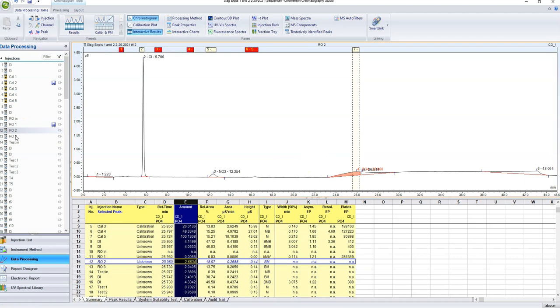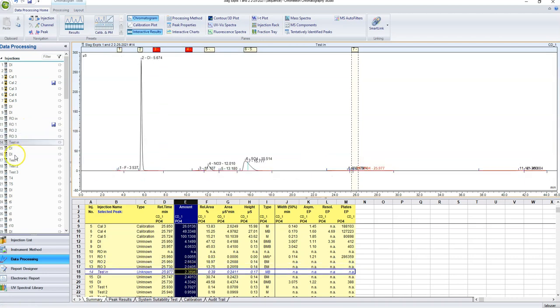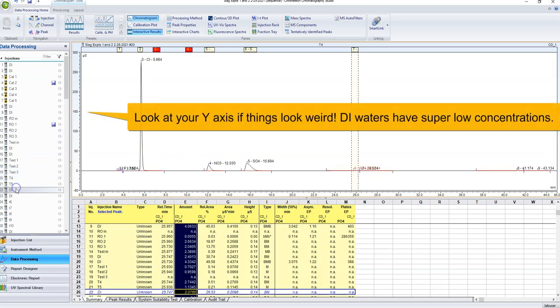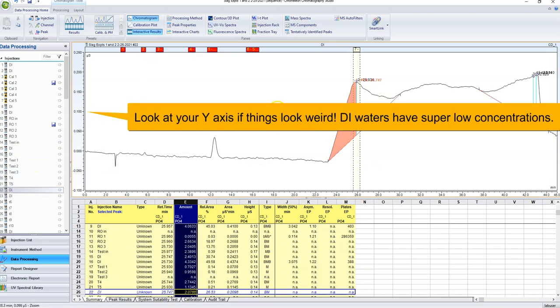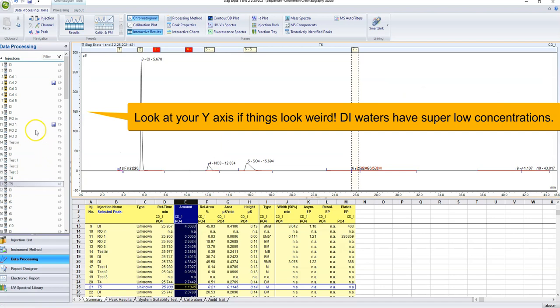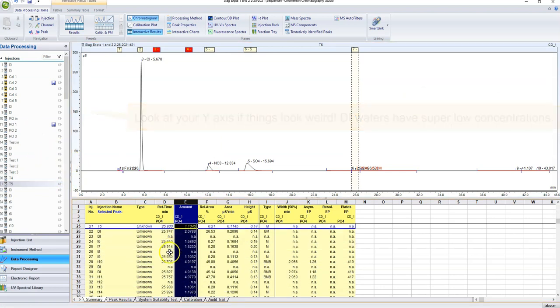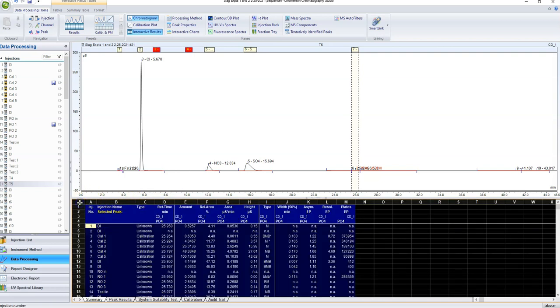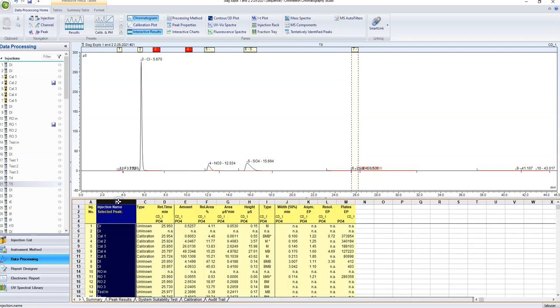But you should be doing this for each and every one of your samples. You can see a lot of mine are messed up, so I'll have to go through them and actually select that phosphate peak, make sure that it actually looks right. That was a DI water, don't worry about it. But yeah, once you've done that and you've gone through all of your samples, it is as easy as just copying this, Control C or right click. Looks like right click copy paste doesn't work, but with Control C and Control V, you can copy this entire table and just paste it in Excel, or just copy this individual column.